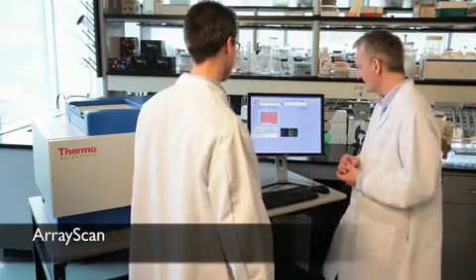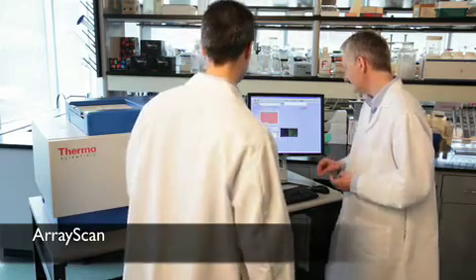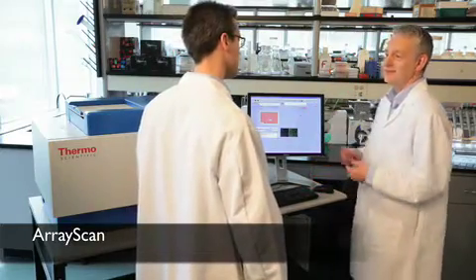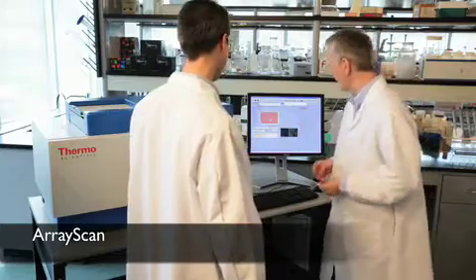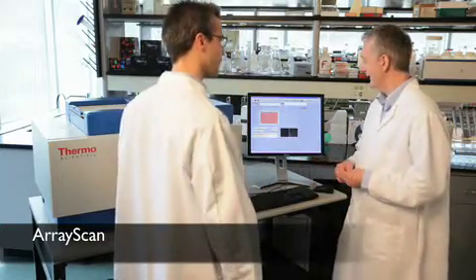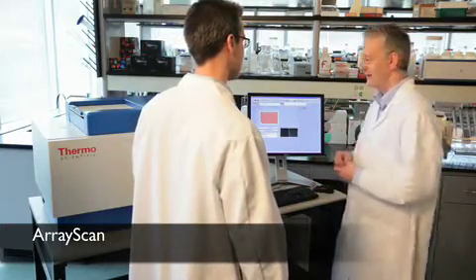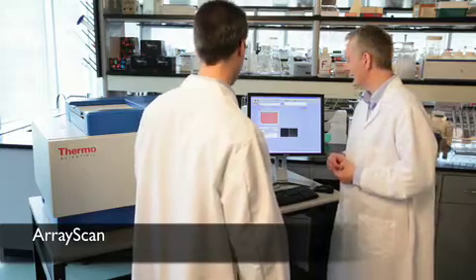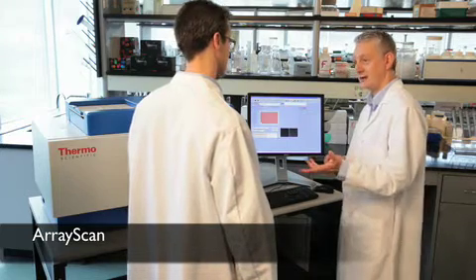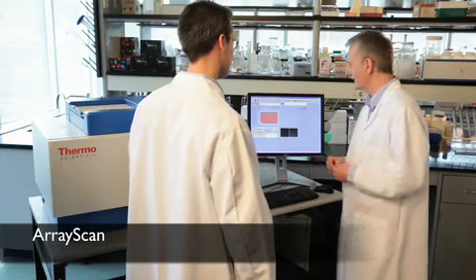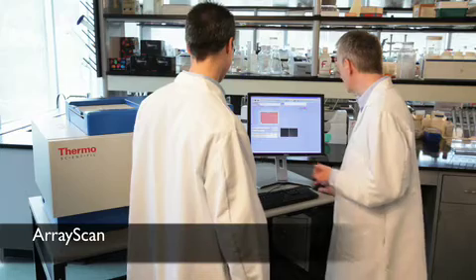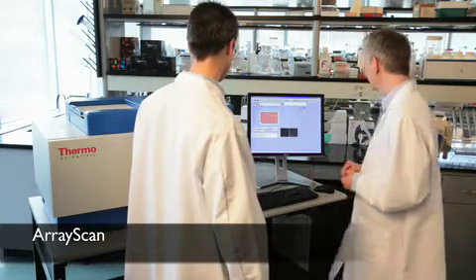So it looks like we're nearly done. A few more seconds. We're finished. And we can take a look at the data in the viewing application. So, obviously, normally we wouldn't stand and watch it, right? Right. This is your first time. So I thought we'd take a moment and take a look at it as it's working. Normally, we'd scan the plate. We'd load the instrument up, scan the plate, and then we'd walk back and look at the data in your lab. And, again, we do have some robotics so that if you did want to load up a stack of plates, 40-odd plates or so, you could do that. That's good to know. And go home for the evening rather than sit and watch this thing. Okay, so it's finished, and let's take a look at the data.